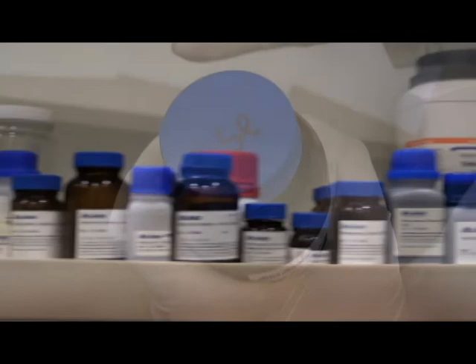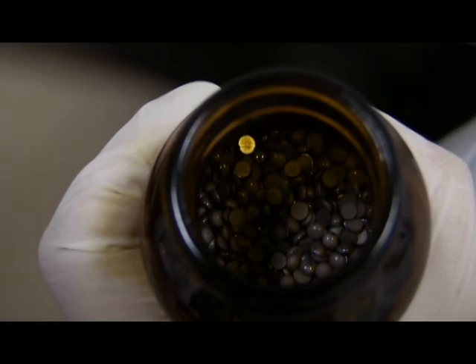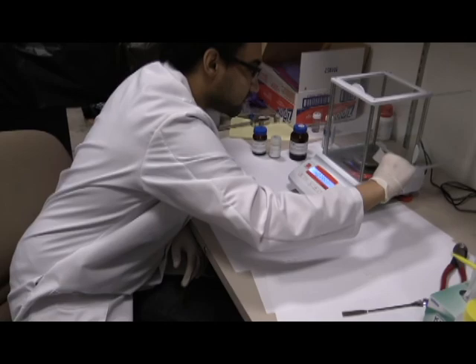We have a wide variety of elements which we use to grow our crystals. The elements are often in powder form or come in small pieces which need to be cut smaller. The powders and pieces are carefully weighed and mixed together according to specific ratios which are established by the literature. Some of these recipes we've developed ourselves.